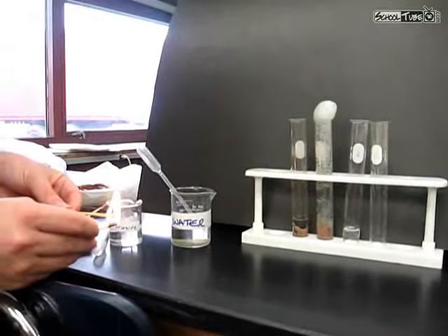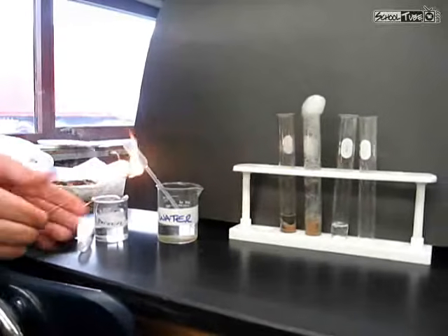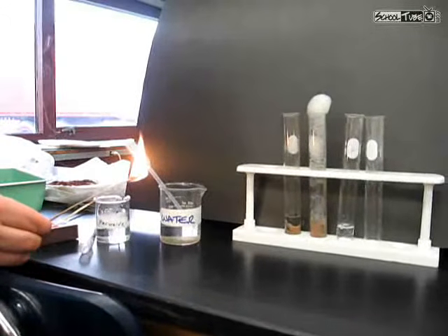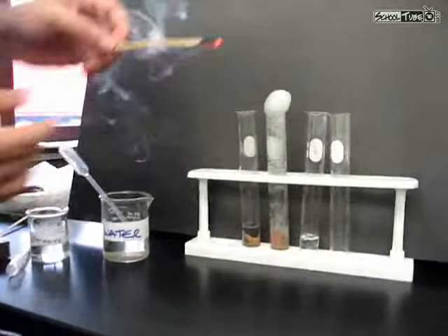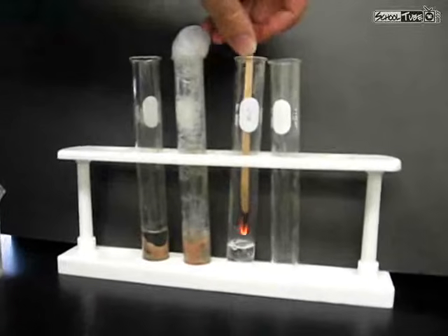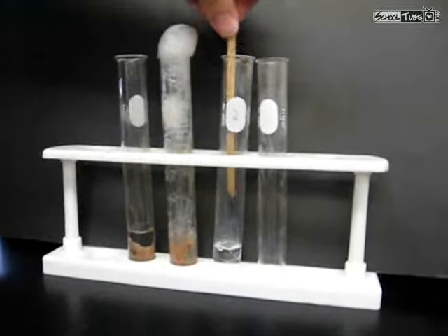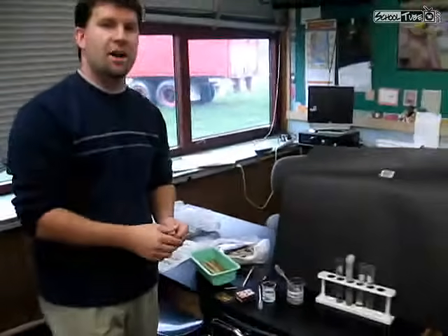And the technique we're going to use is we're going to let the wooden splint burn for a while, and then after a while, as it's burning, see how it's glowing red? What we're going to do is we would slowly put that down into the tube, and nothing happens. It's because peroxide itself isn't flammable. So we wanted to prove in this tube that peroxide isn't flammable, so that what happens next will be pretty cool.